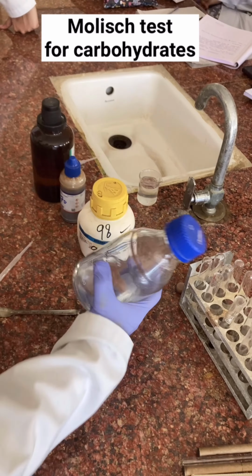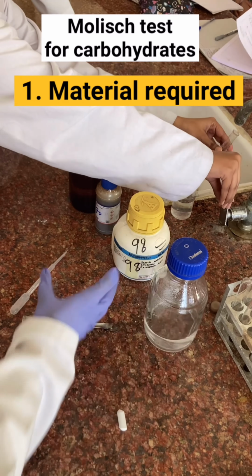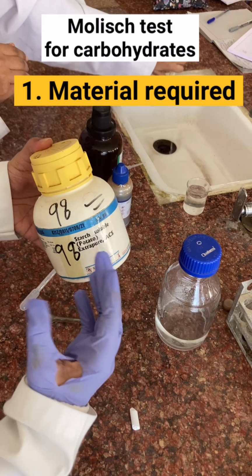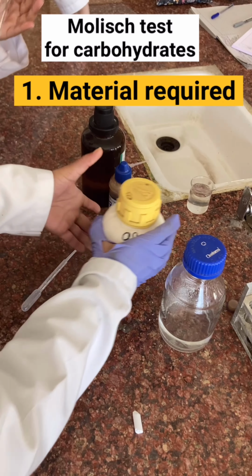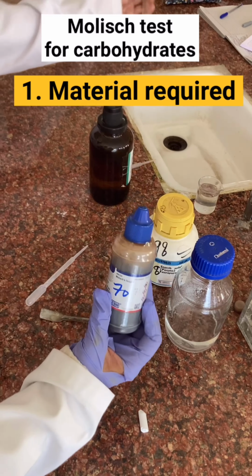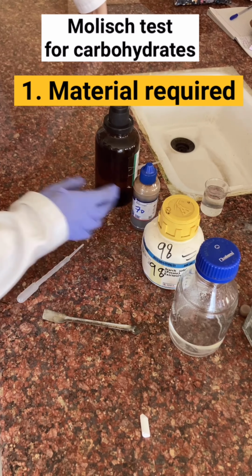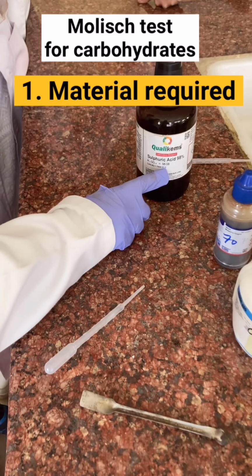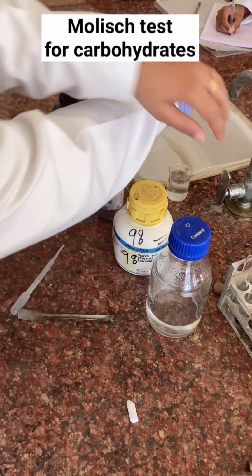We are performing the Molisch test for carbohydrate. We need the material like distilled water, then we need the starch powder or any monosaccharide, disaccharide or polysaccharide. And then we need the Molisch reagent, which is going to identify the presence or absence of carbohydrate. And lastly, we need the sulfuric acid, and this should be the concentrated one.